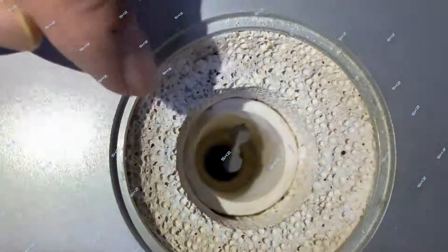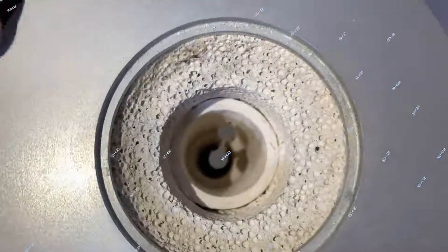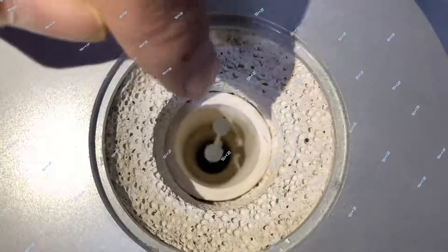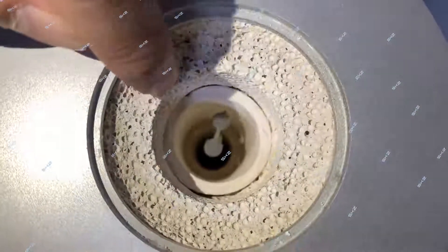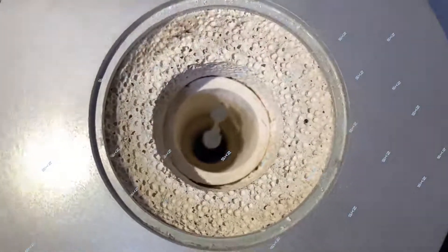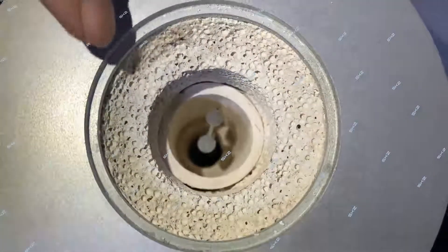Also here, must make sure the sensor cannot touch the wall, the wall of the furnace. Now here is okay.